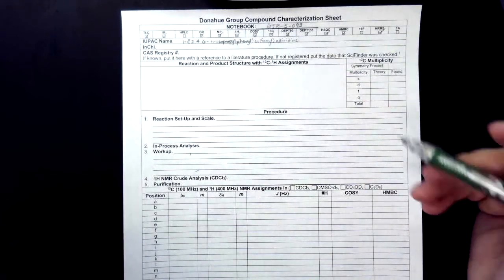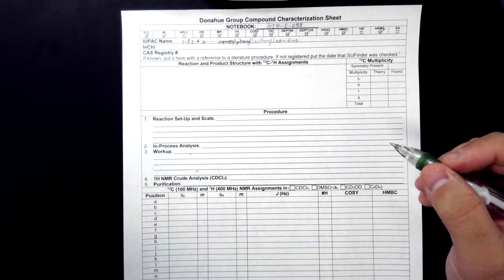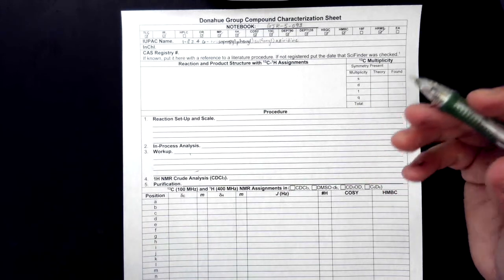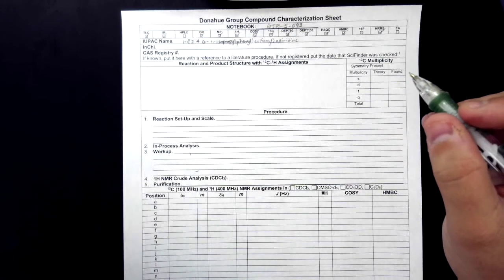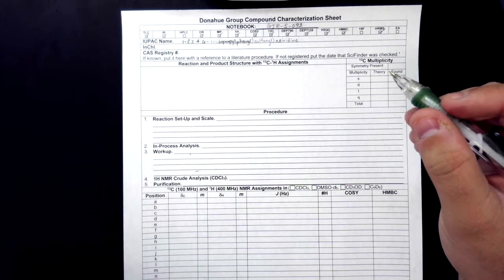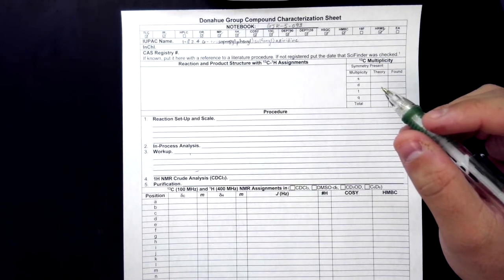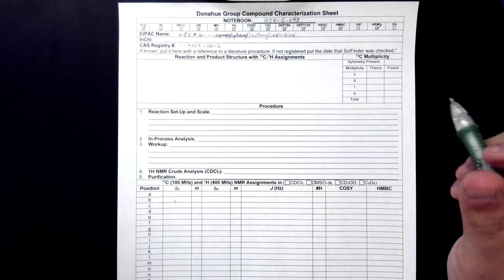The CAS registry number is the number given to each compound from the Chemical Abstract Service. If you go to SciFinder and build your compound, and the compound is known, you'll get a CAS registry number, but if it is unknown, it will not have one. An exception to this is that sometimes a compound will be known but not necessarily have any sources. We'll go ahead and put the CAS registry number since our compound is known. Alright, there we go.